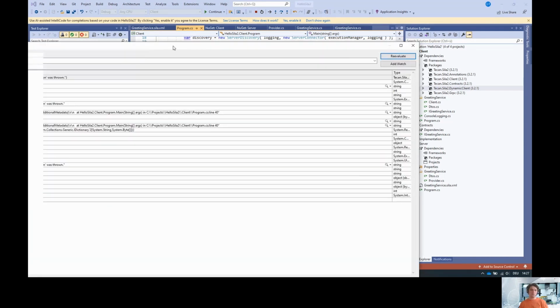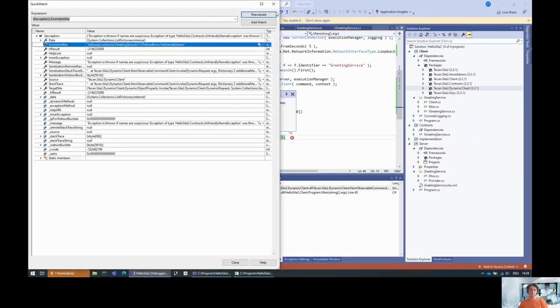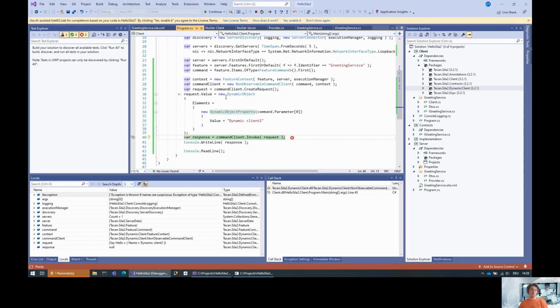This defined error exception does give you the error identifier. So here you see the fully qualified identifier of the error, and the actual message that comes from the server. And this is basically how it works. There's also a client for properties, and as I said, there's a client for observable commands, and that can basically be used to query features that you don't know at compile time.